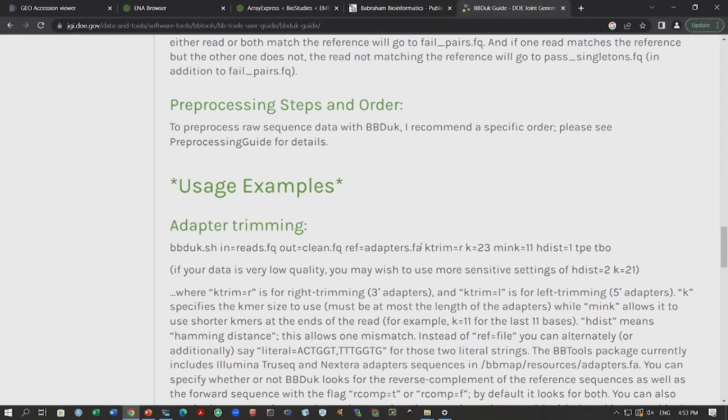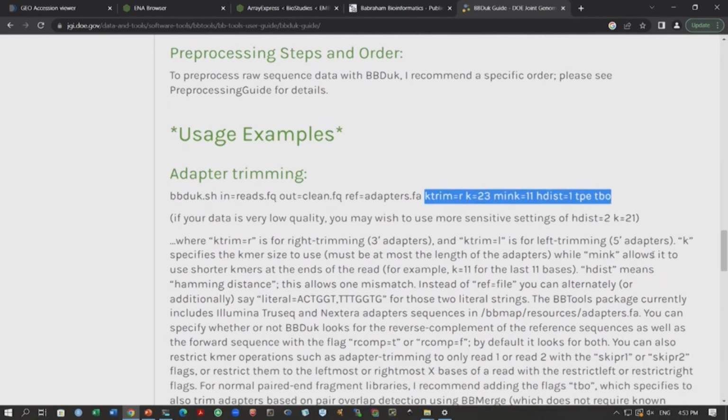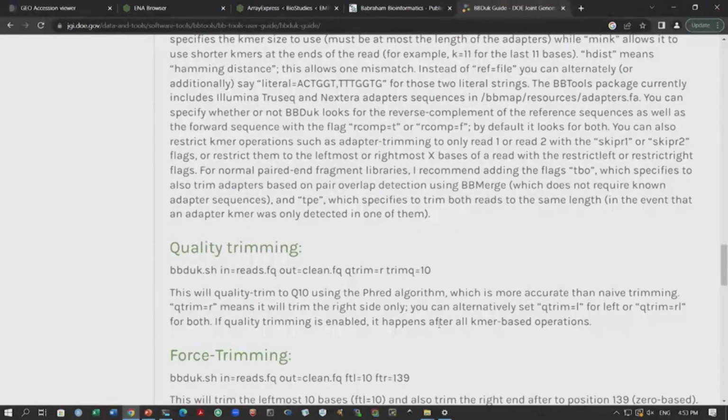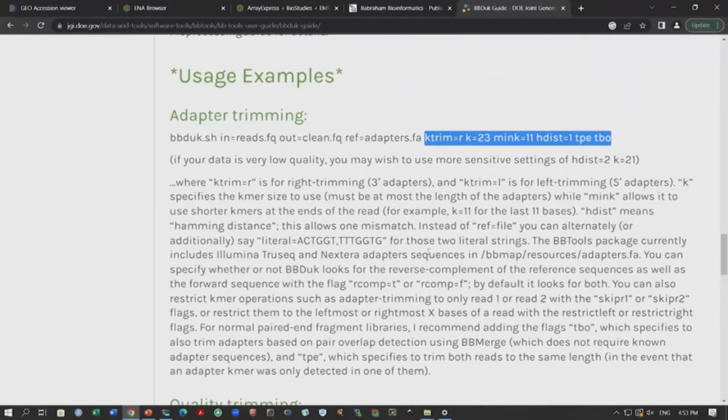What this tool will do is match the sequences of the reads against these adapters, and whenever it finds a match, it will remove those adapter sequences. And then you have certain parameters. Again, we are not going into these parameter values or how this algorithm works, but these are the parameters that they have mentioned we can use, and you can also change this in certain sequences. There is a very nice explanation following this on how we actually remove these adapters. And if you are interested in quality trimming, then you have to follow certain other parameters, and we will not go into that because our quality score is pretty good.